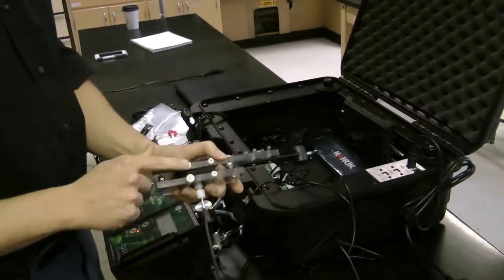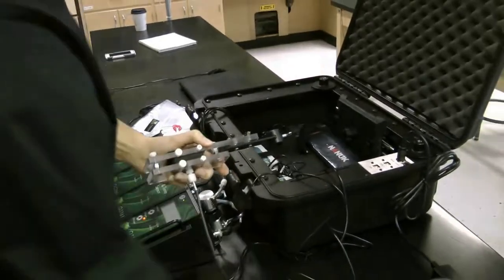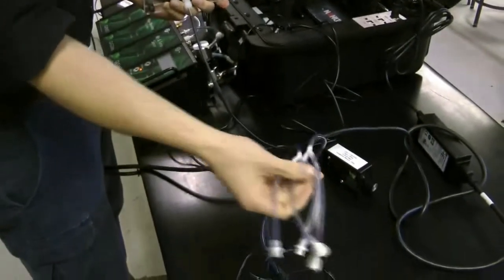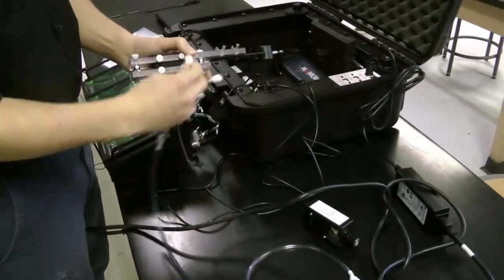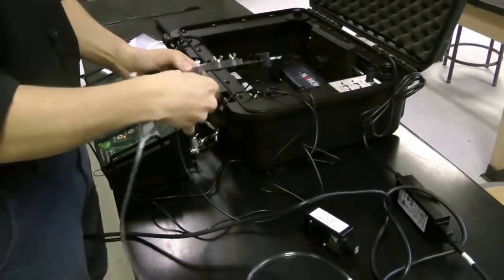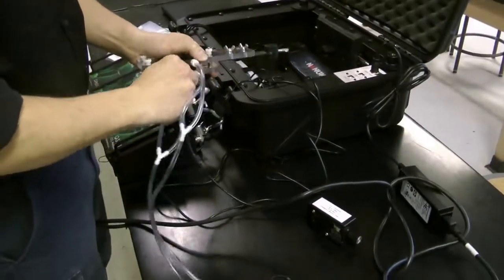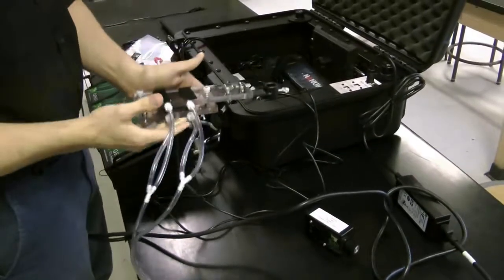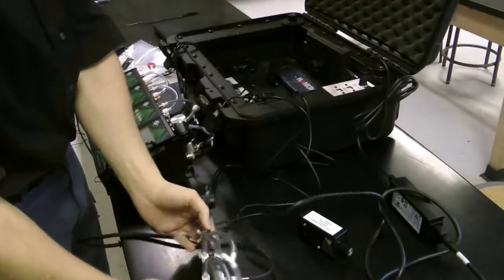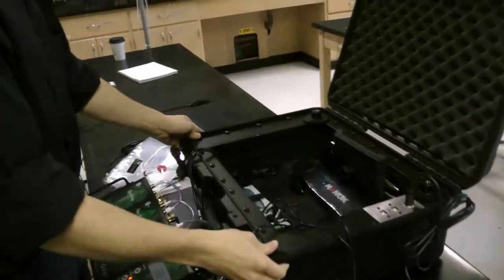As you can see here, there are 4 Luer lock fittings. These fittings are used to connect to 2 Y connector tubings. Take each and connect them to their respective ports: female connection to male connection, and male connection to female connection. Now set aside your leaf chamber for now. We'll move back to the QBox.